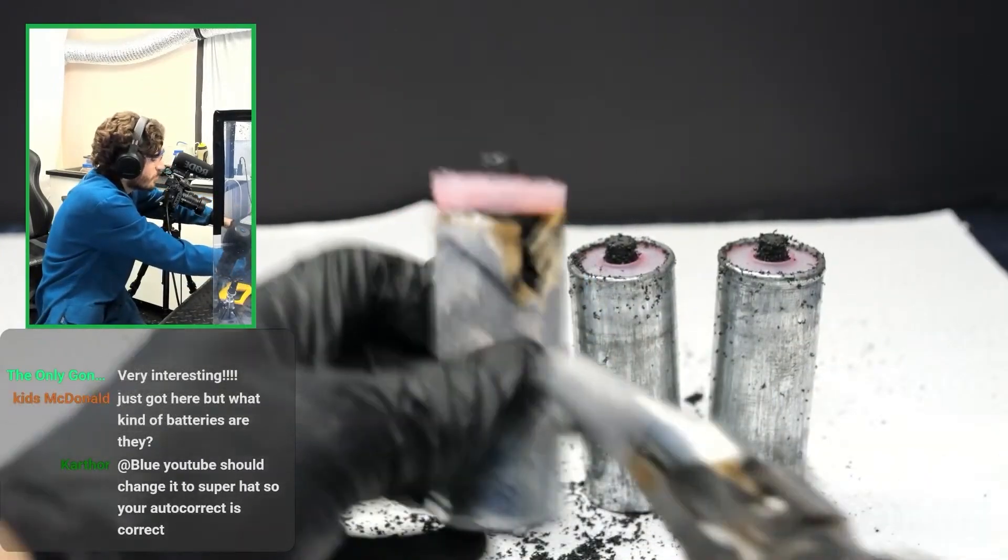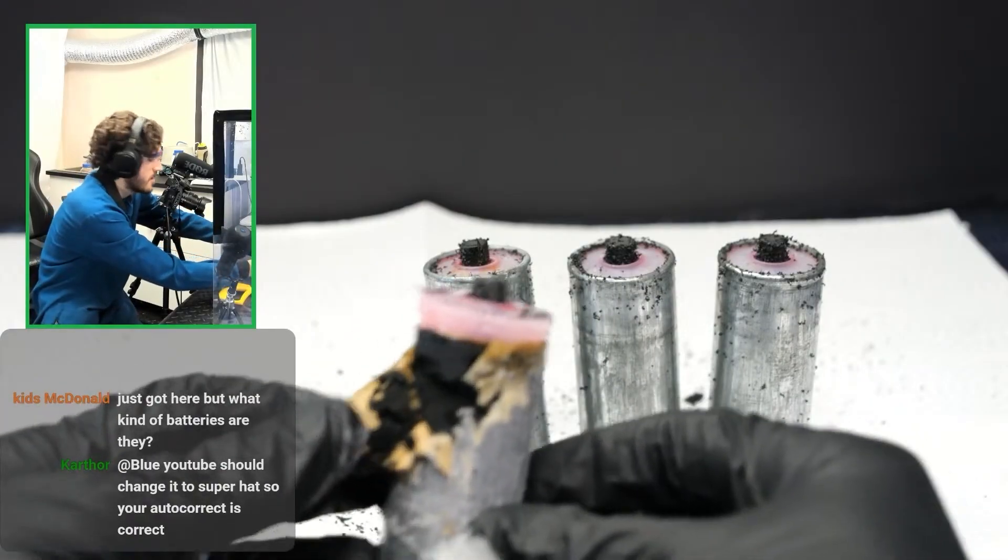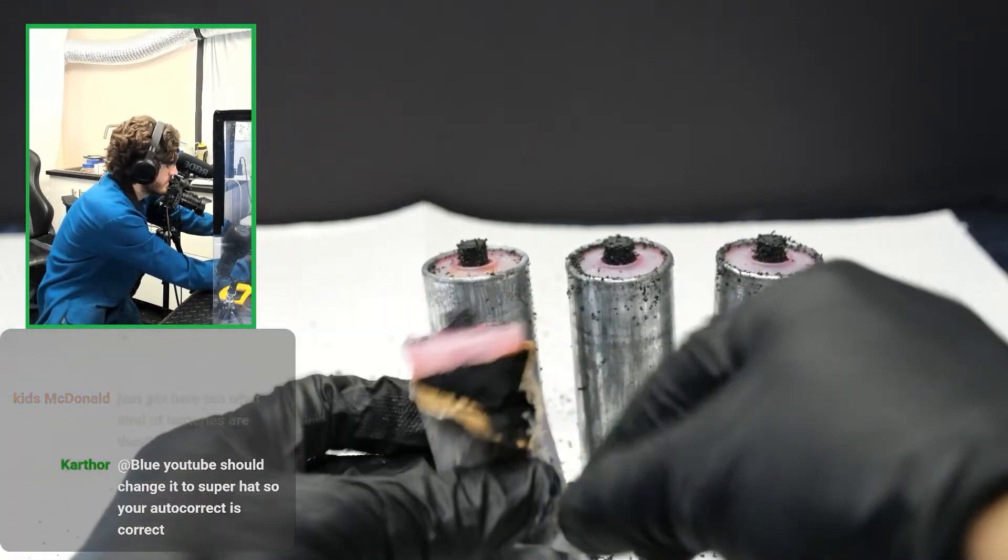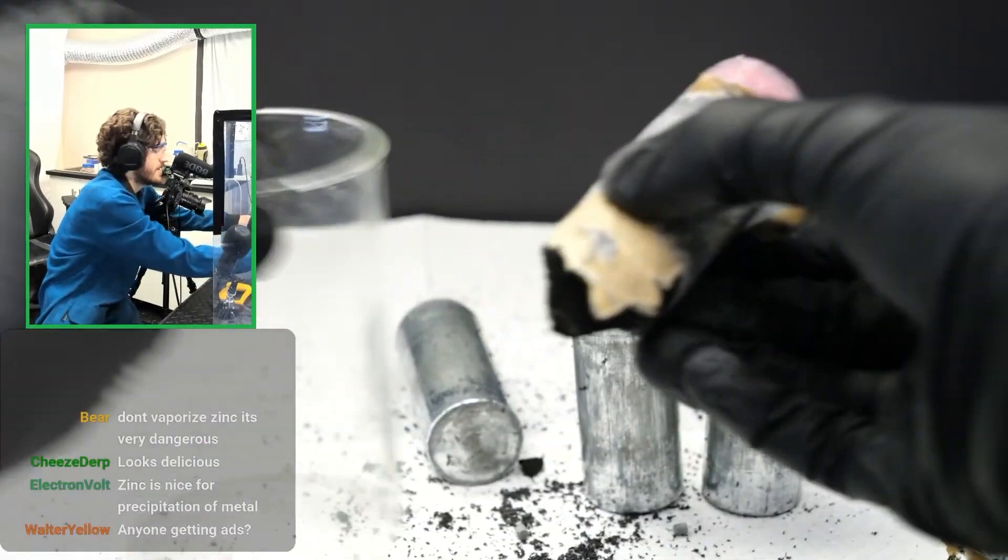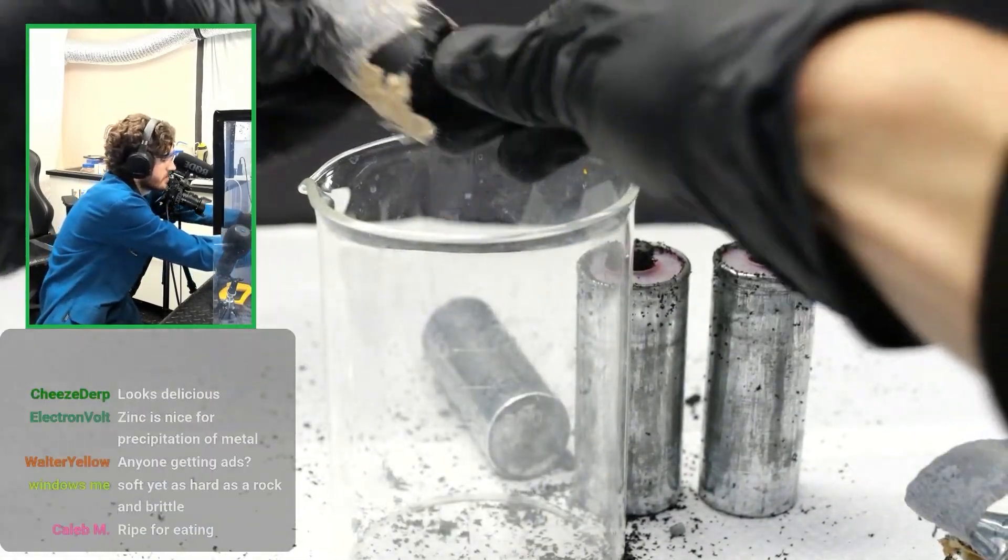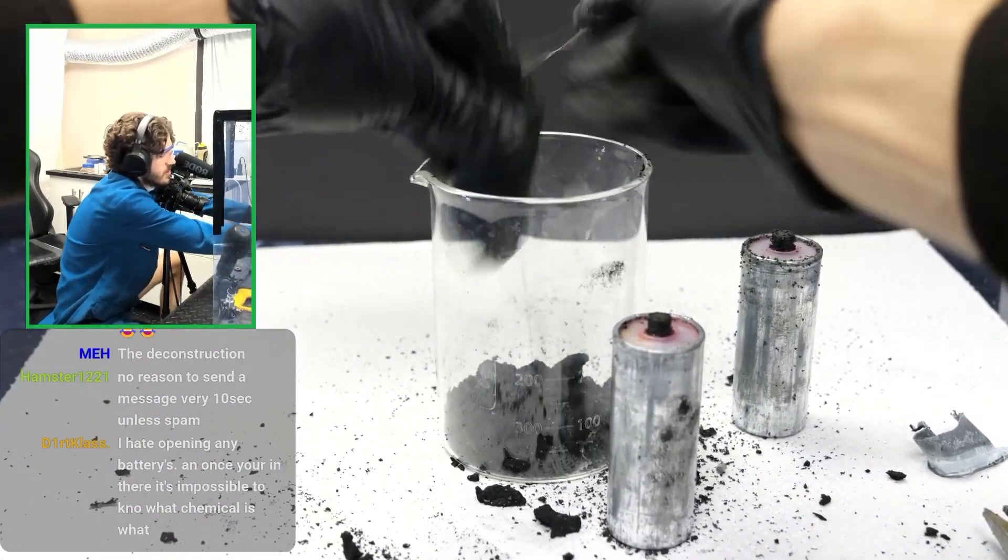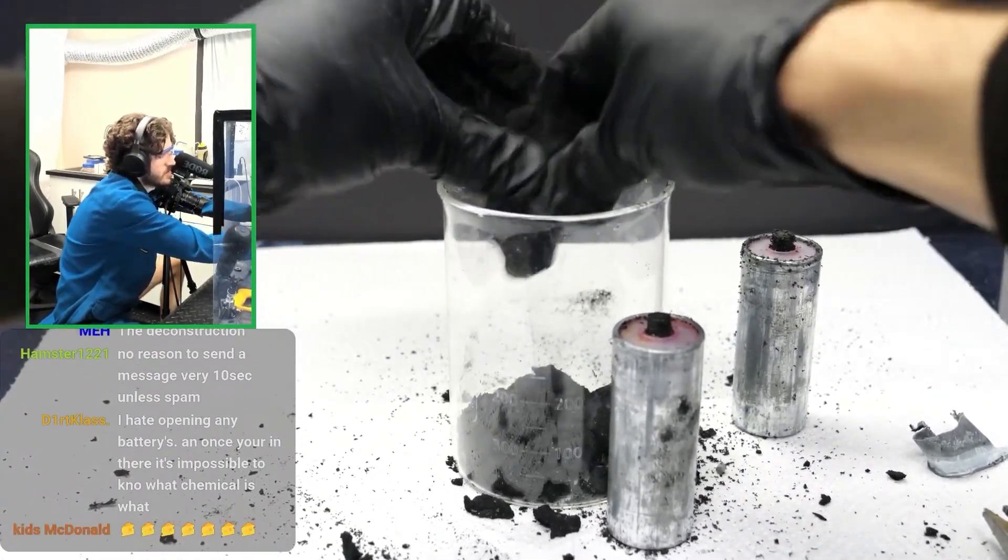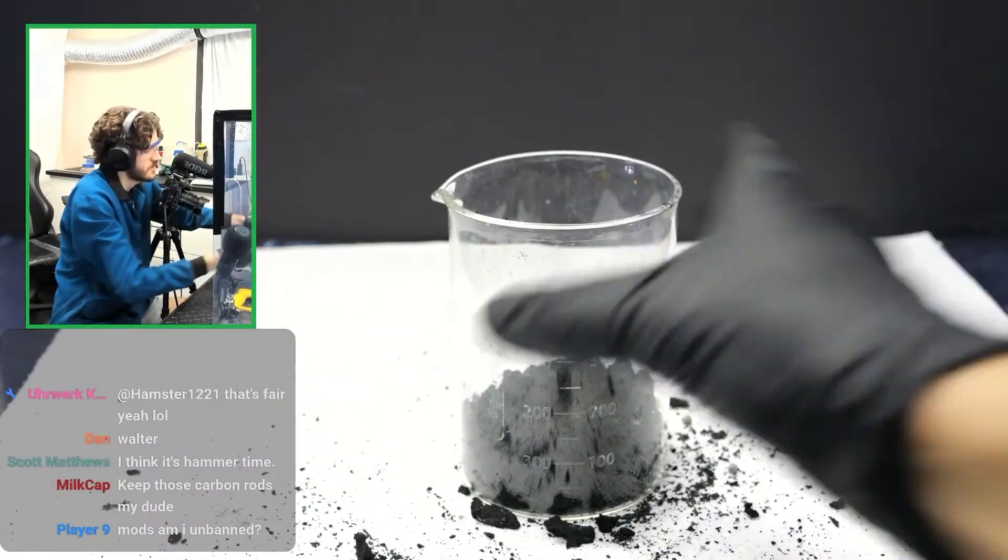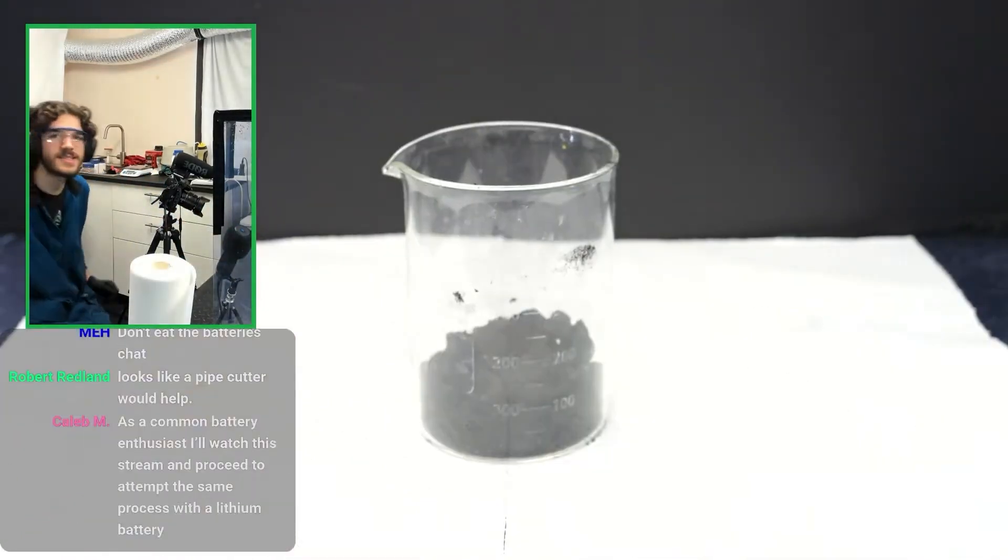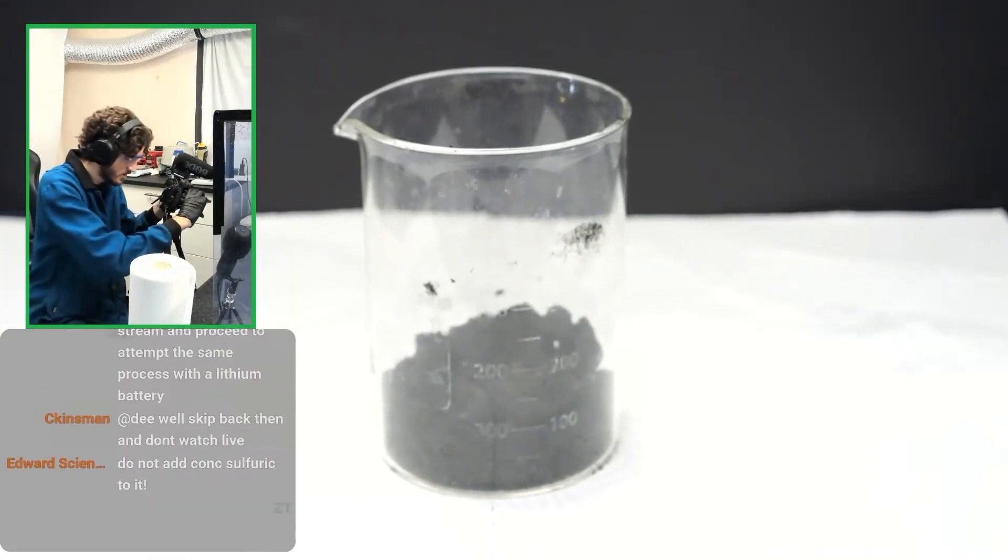Oh yes. Yes. It's the right battery. Look at the black shit that's in there. See that? See that black gunk right there? That is what we need. That is the manganese dioxide right there. So I'm going to try to open this cartridge up as much as I can. And now I'm going to collect this inside of another beaker. This is what I mean by like, this is so messy. I might only do two, two cells of this because otherwise this is going to take forever. Okay. I think I'm going to give up. I think this is enough to work with.